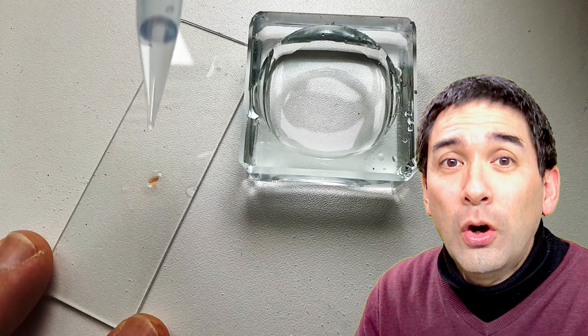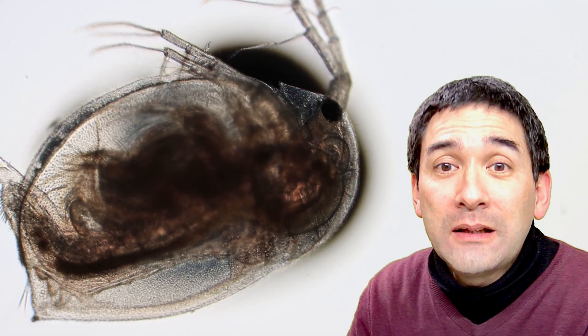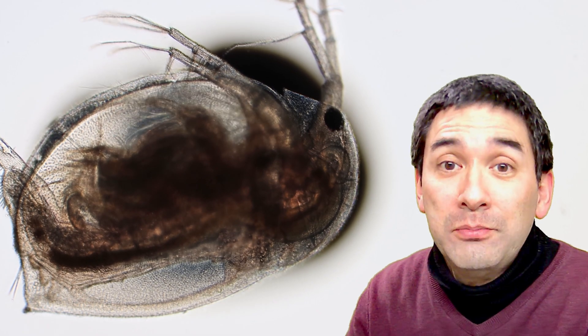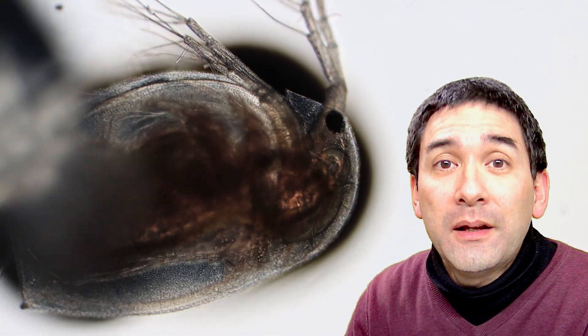And then I simply added a drop of this diluted alcohol solution on the Daphnia and I put it directly under the microscope, and I also added some alcohol directly under the microscope.